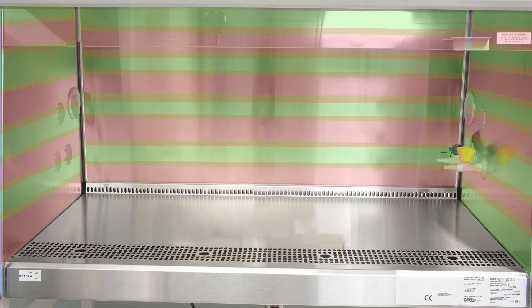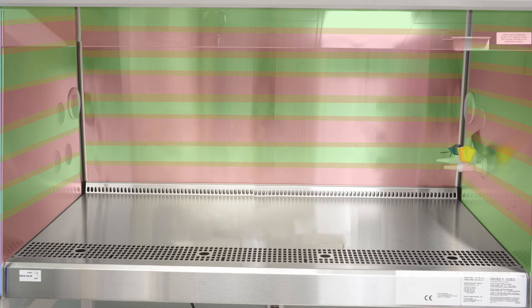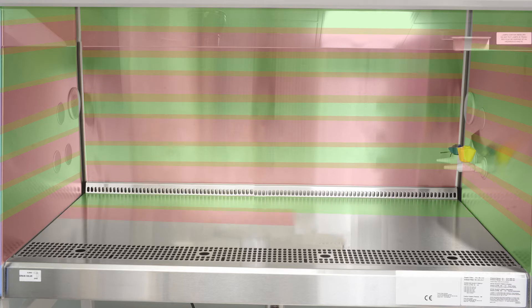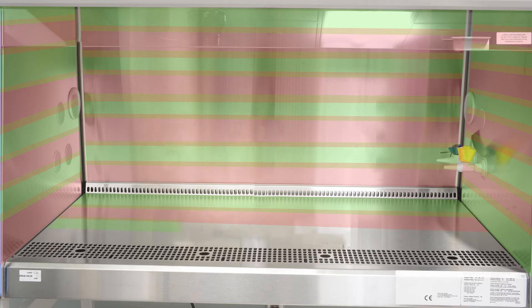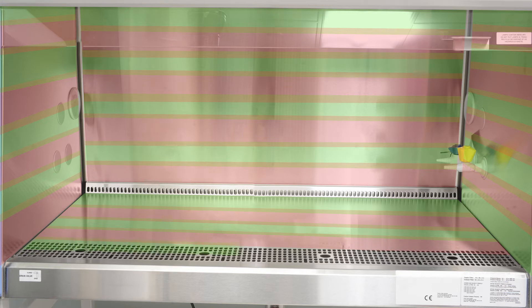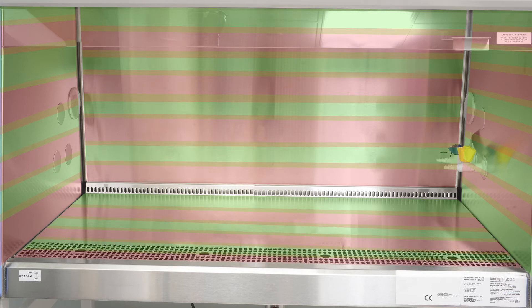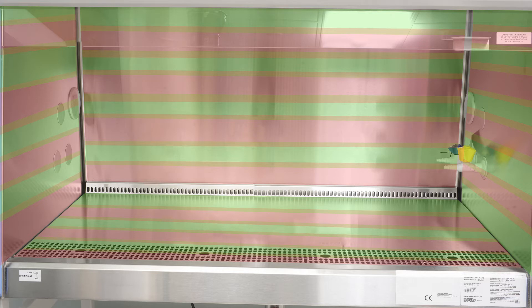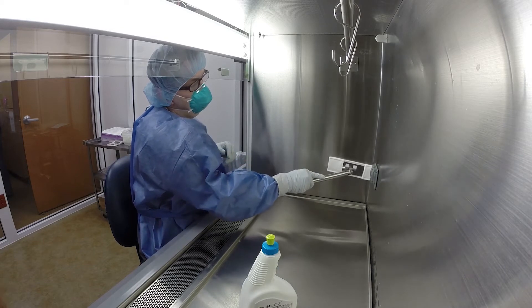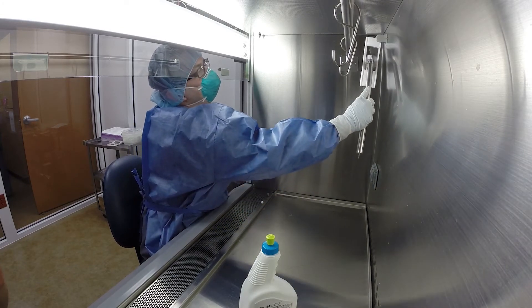Once the interior vertical surfaces of the unit have been wiped, you're ready to clean the horizontal work surfaces. Begin the wiping process in the back left corner and wipe across the surface to the right. Continue working from the back of the surface toward the front using overlapping strokes until the entire area has been covered. While this is the most commonly used wiping technique, there are similar variations in use. The EasyReach cleaning tool's swiveling head makes cleaning corners and hard-to-reach spots a lot easier.